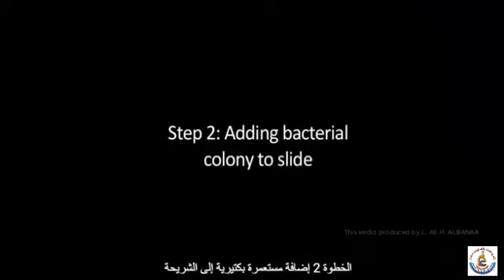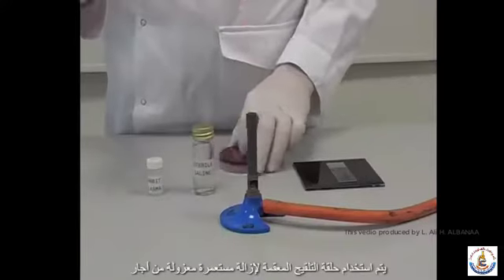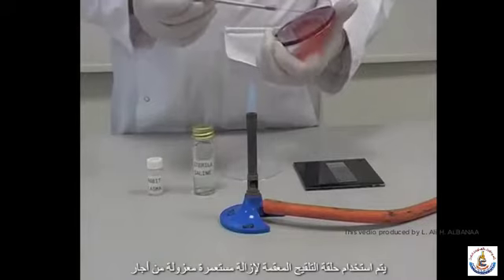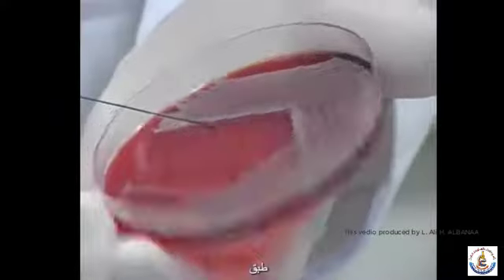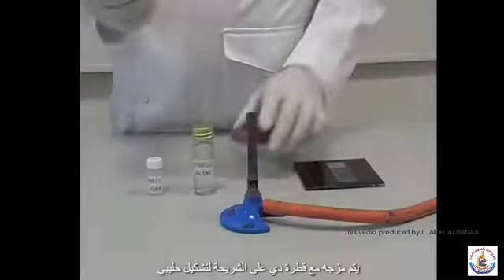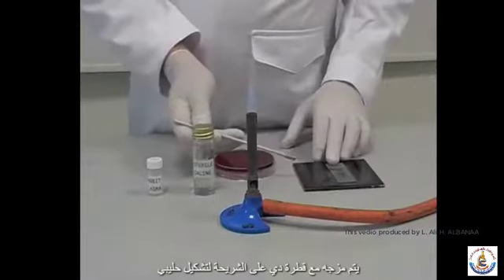Step 2. Adding a bacterial colony to the slide. A sterile inoculating loop is used to remove an isolated colony from an agar plate. It is mixed with a drop of saline on the slide to form a milky white suspension.